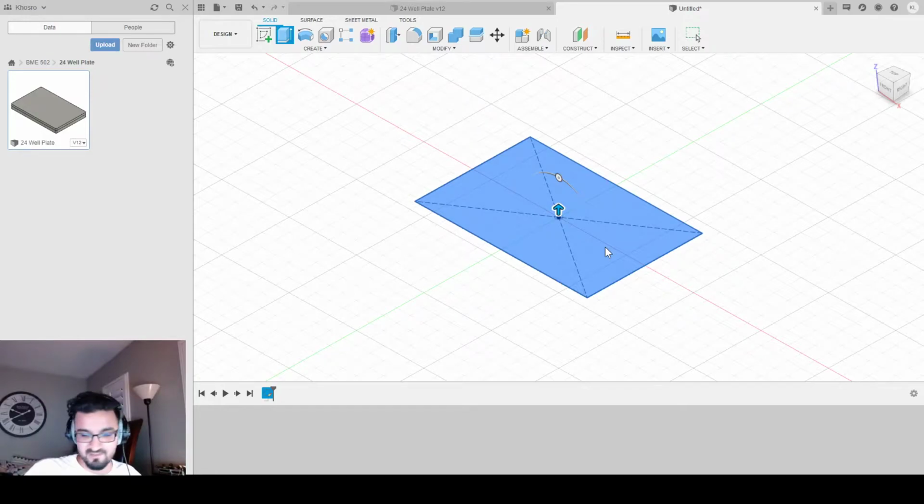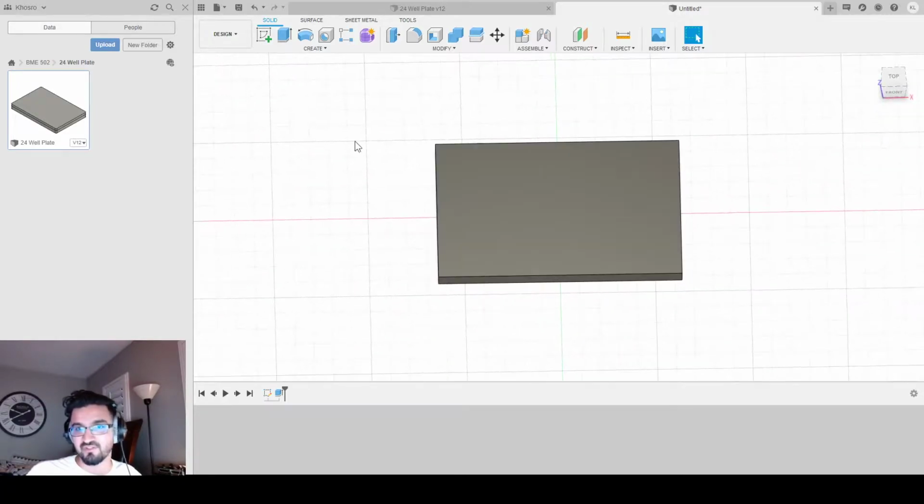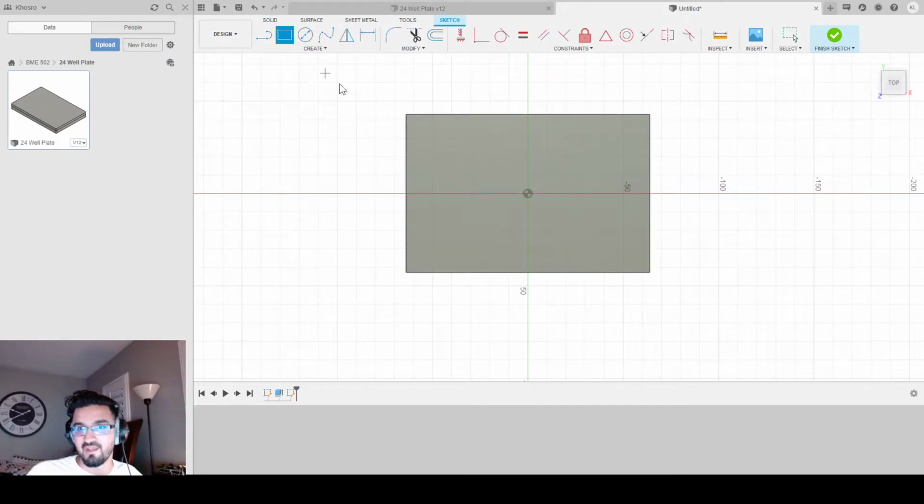We're going to extrude this out by a height of 6.8 to get our 2D structure to a 3D structure. Then we're going to create another sketch on the top surface. I'm going to select a 2-point rectangle and select both these corners to get the same rectangle I got before. And then I'm going to offset this by 1.5, so it goes in by about 1.5 millimeters, and this is going to be the section where my plate is going to extrude eventually, so my lid has this gap to come down. You'll see later, it'll make sense.